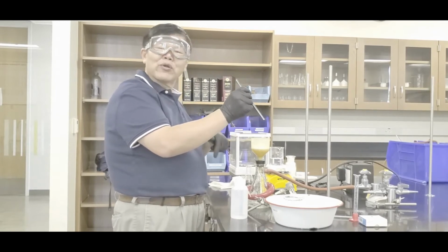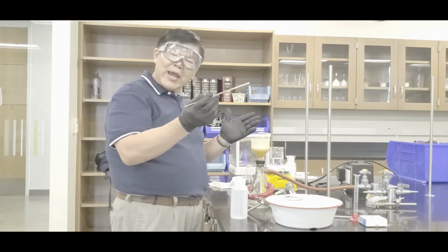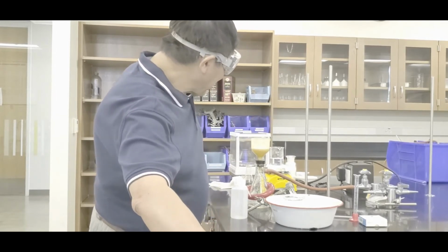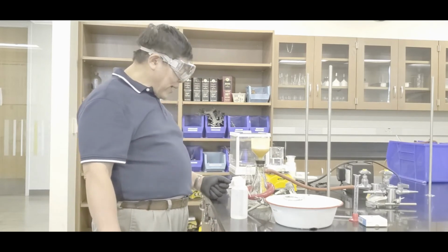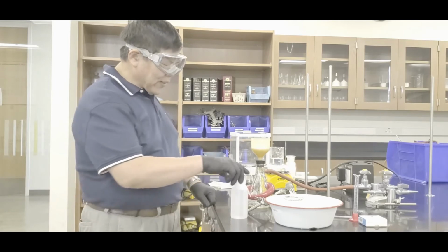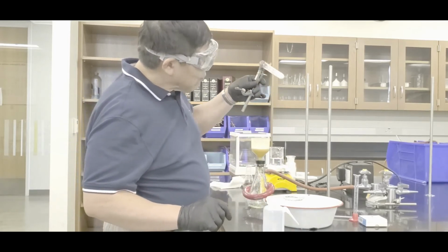You don't want it to give it away, go around, okay? So there we go. All right, tap, don't tear, okay? So in that case, it looks like we're good, yeah? So when it's ready, what you want to do is something like this. See? All right, it's ready, okay?